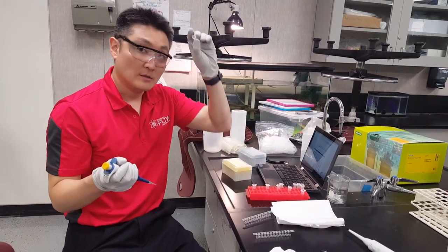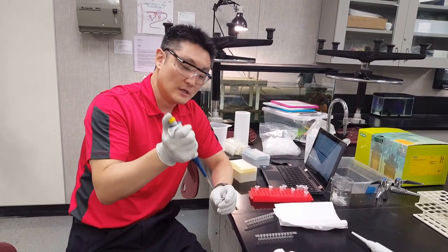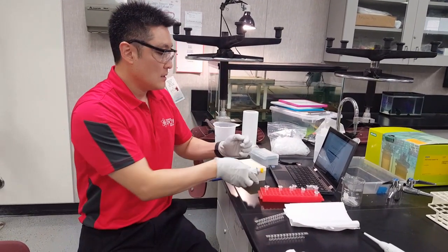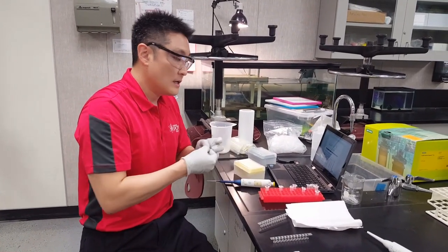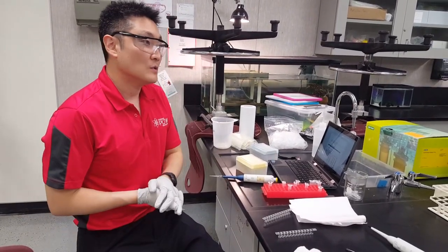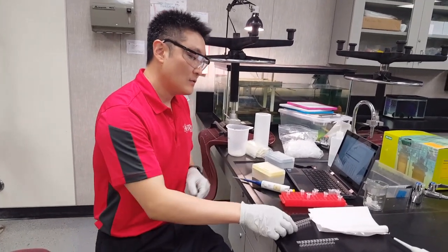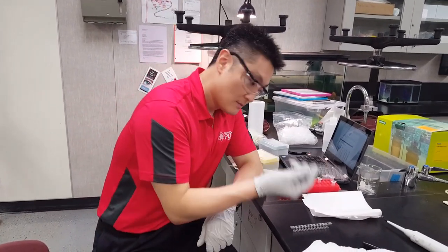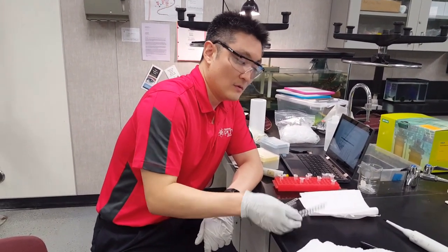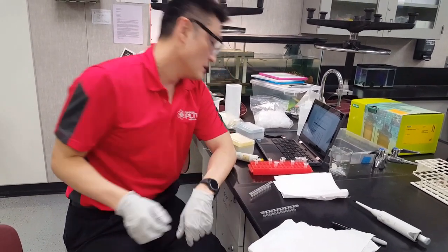Now get the secondary antibody and pipette 50 microliters of secondary antibody into every single well — all 24 wells. Then let it incubate for 5 minutes. Go relax — say hi to the betta fish. After those 5 minutes, invert 5 times: 1, 2, 3, 4, 5 for both strips.